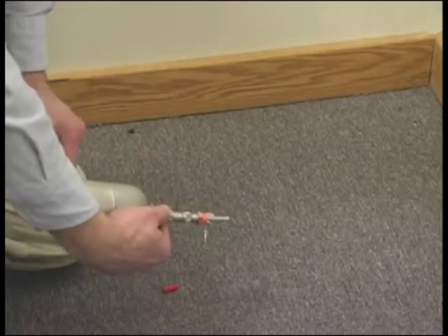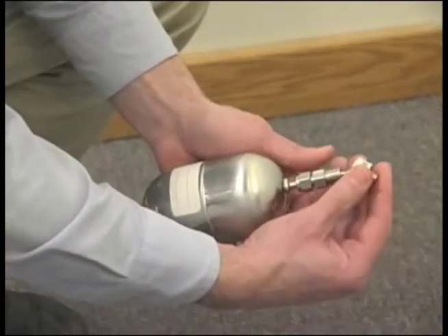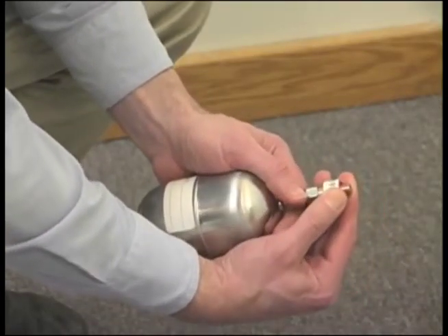Or if you have one of the grab regulators that do not connect to the stem, just slip the regulator over the stem and hold for one minute.